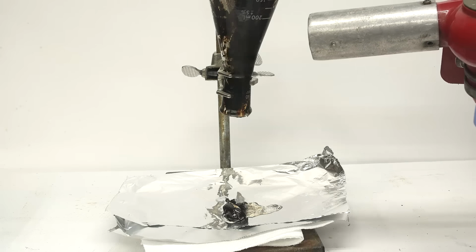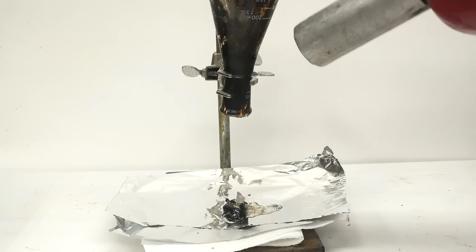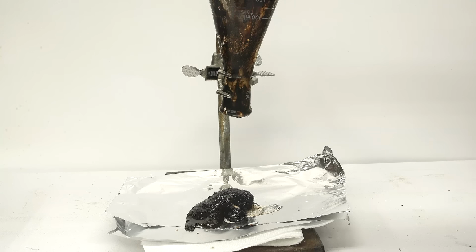As I mentioned earlier, the cleanup was a huge pain, and to get things out, I had to blast it with a heat gun. The footage here is kinda funny, and I don't think I have to tell you what I think it looks like. When I got out as much as I could, I let it sit in a base bath for about a week, and then I was able to rinse the rest out.